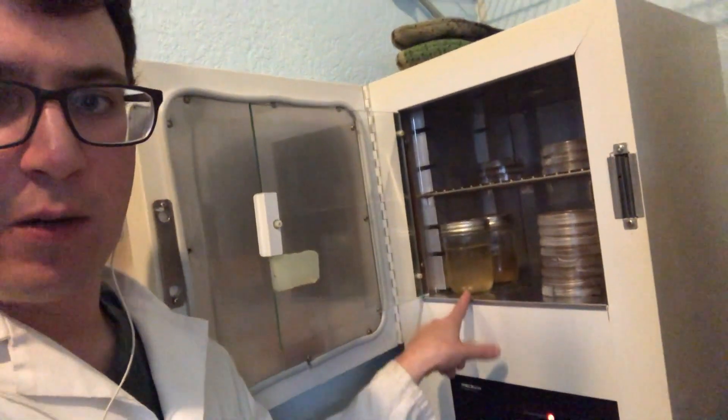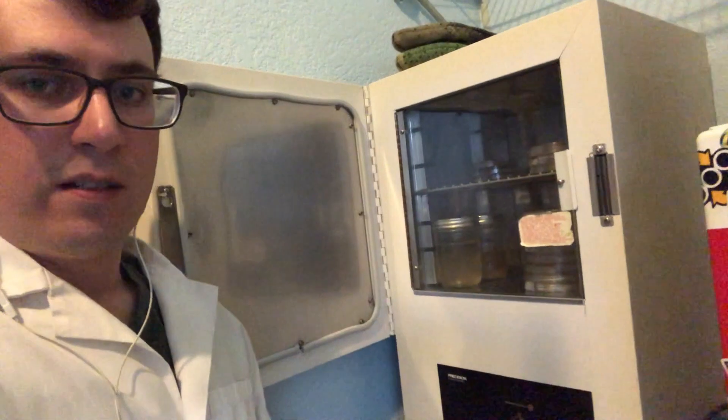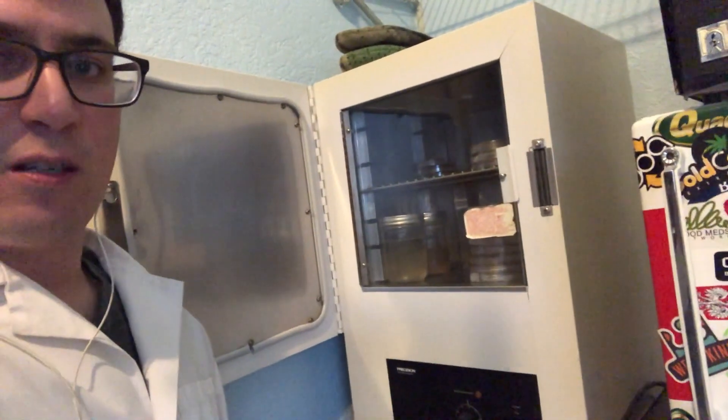And then I've got a couple liquid cultures that I'm just waiting on the QC before I go ahead and use those. So that's my incubator, it's super basic.